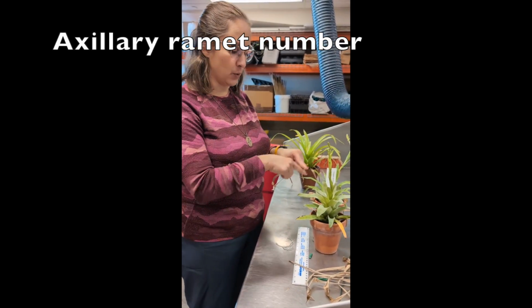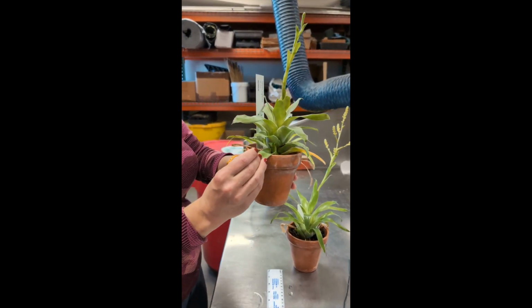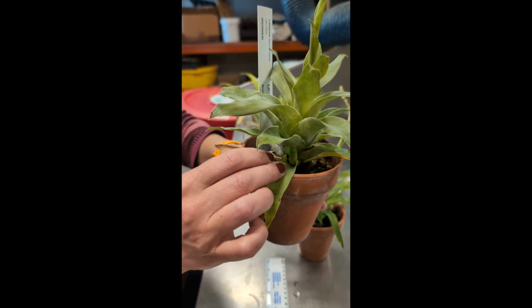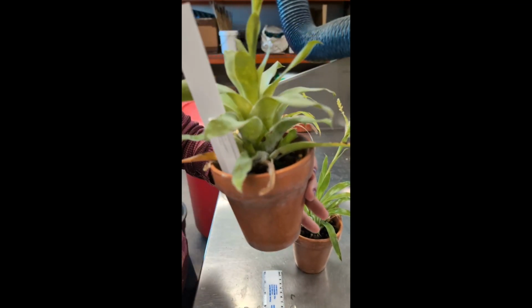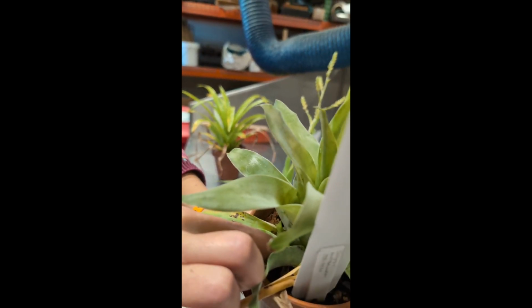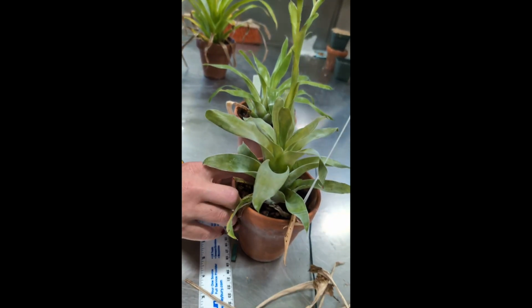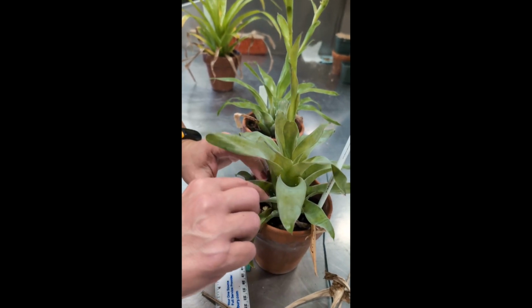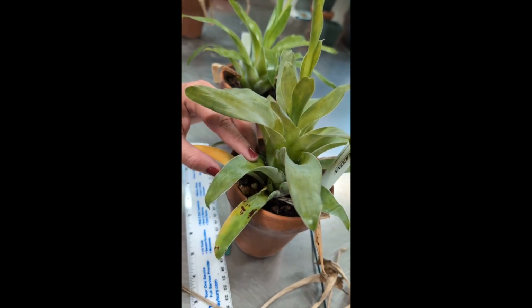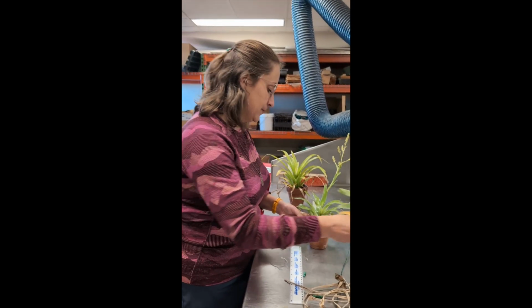Finally, I would want you to check for axillary ramets, or the little pups. And so you're going to want to peek often on the lowest or the oldest leaves and count them. And here's 1, here's 2, here's a little one, 3, here's 4, here's 5, even on this date and time. Then I can look up a leaf and I see nothing in here. So again, you're kind of going in developmental order. And in this case, there was 5.